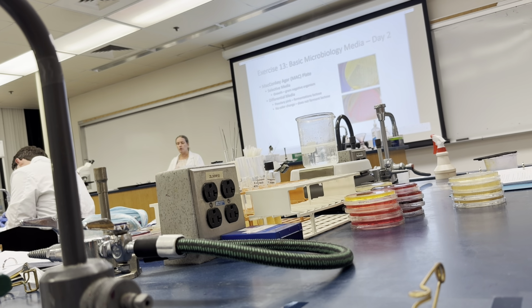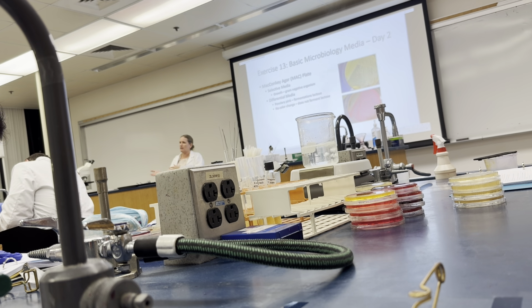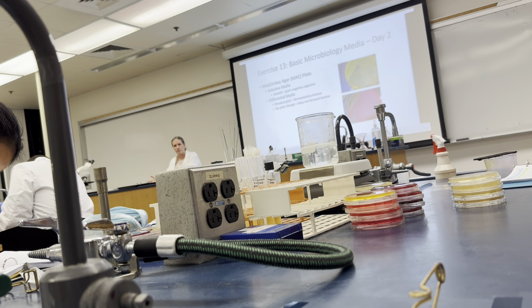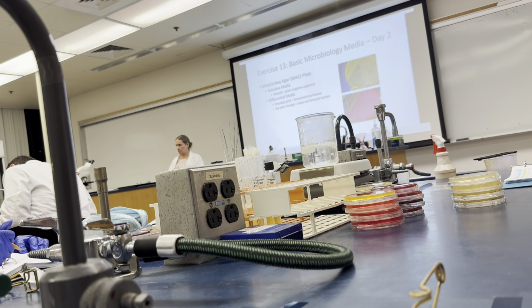It's the fact that we use different media. They are different. So the question comes up, well, this is kind of yellowish looking. Does that mean it's acidic? No, because it's a different media compared to another media. This one has neutral red. Neutral red has a certain appearance in acidic condition, right? So that's what I'm looking for. Not, can you tell me this organism, what's it going to look like on this media? All right? Questions?